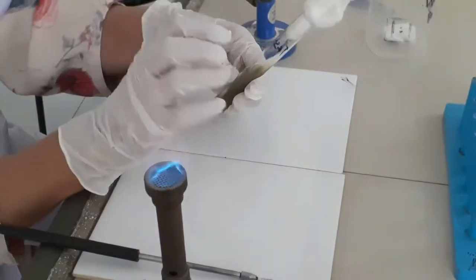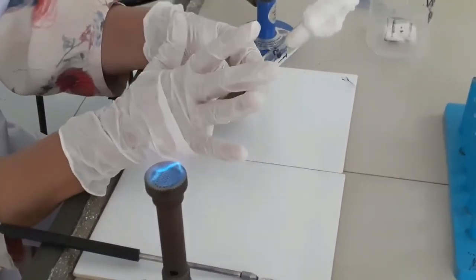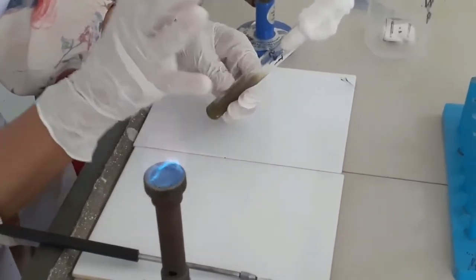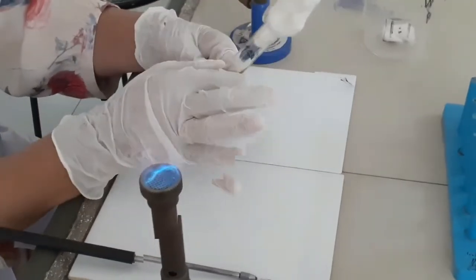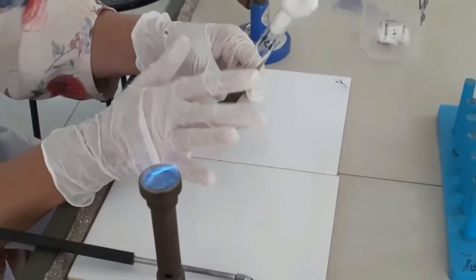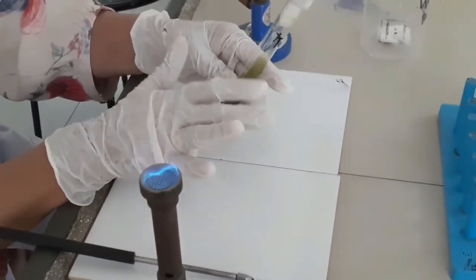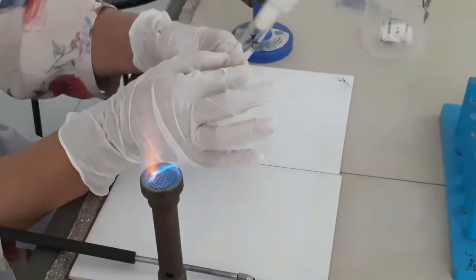That means the test organism is not capable of utilizing sodium citrate as a sole carbon source, because these organisms lack the specific enzymes, that is citrate permease and citrase. This is how we can interpret the result of this citrate utilization test. E. coli is an organism that gives this test negative.